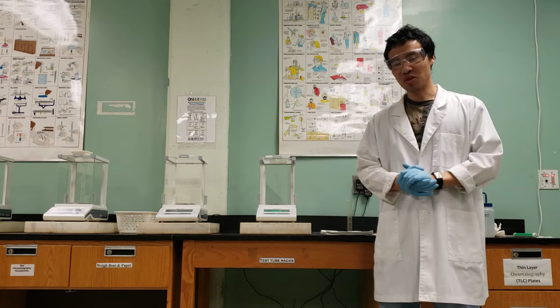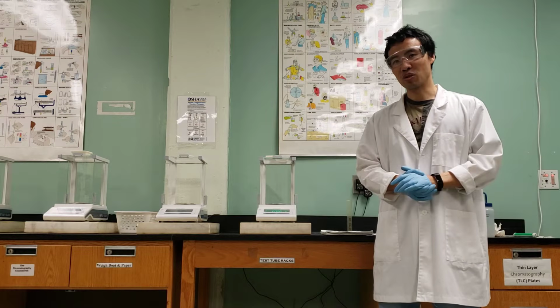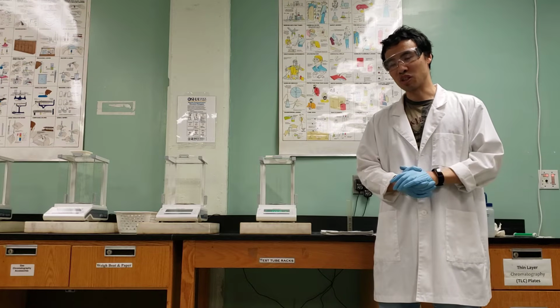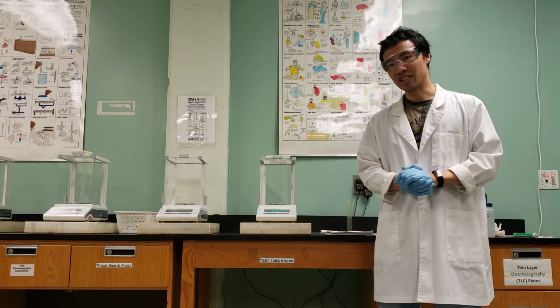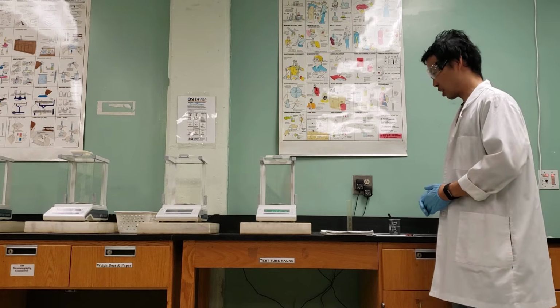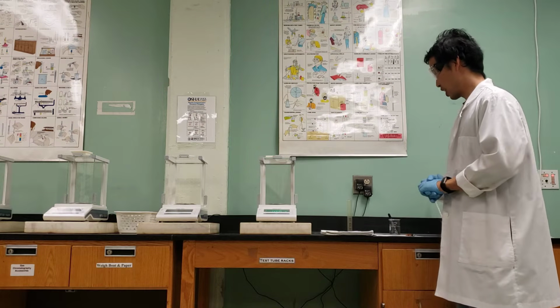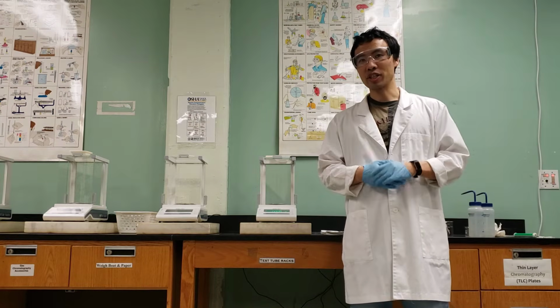Your respective instructors are going to give you an introduction. They're going to communicate with you how they want you to present the data, or how they want you to write the discussion, what terms to put in, and what to address. But I'm just going to show you the methodology for the lab, the procedures, and then I'm also going to show on the whiteboard later what data we obtained.